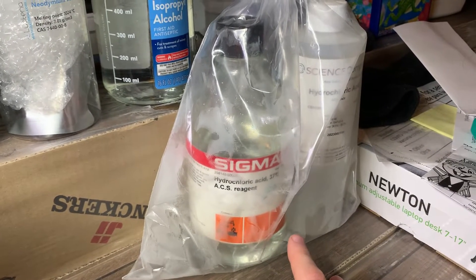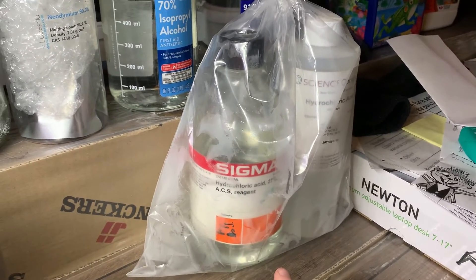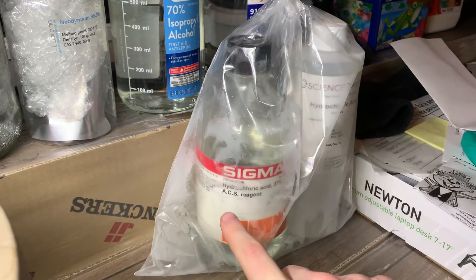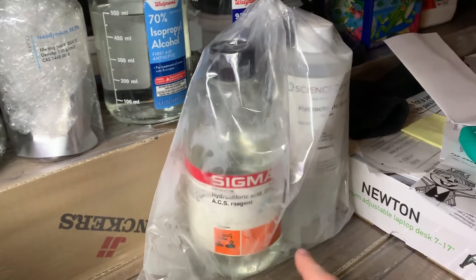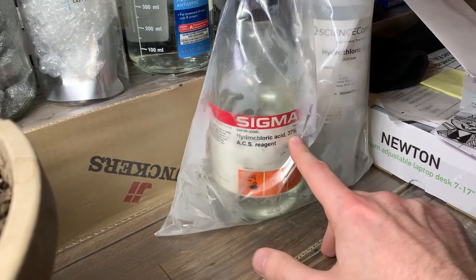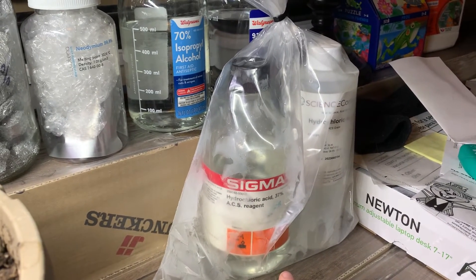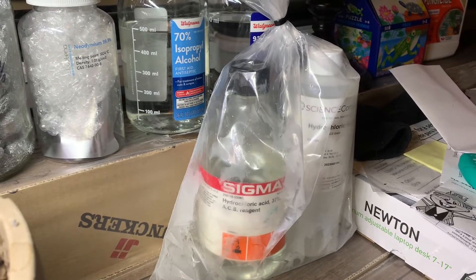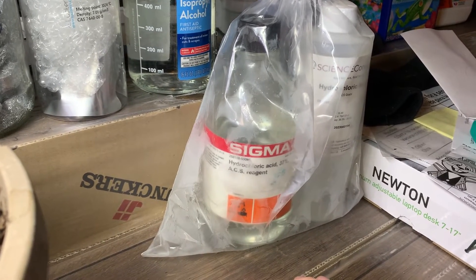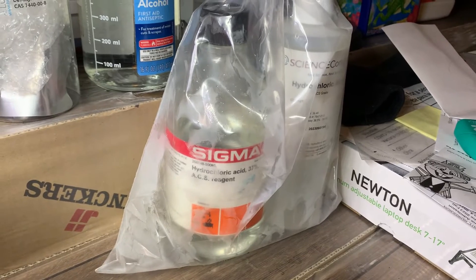This HCl bottle here I bought empty and totally clean, basically because I thought the label looked cool and I liked the shape, and the fact that it was made out of glass. But I also figured I could reuse it since it is designed for HCl after all. The HCl that comes in these bottles is almost exactly the same as what the label says — ACS reagent grade, 36.5 to 38%, which covers tightly the 37% value listed on the bottle. So I emptied the rest of the bottle I poured from into this one and disposed of the plastic bottle.